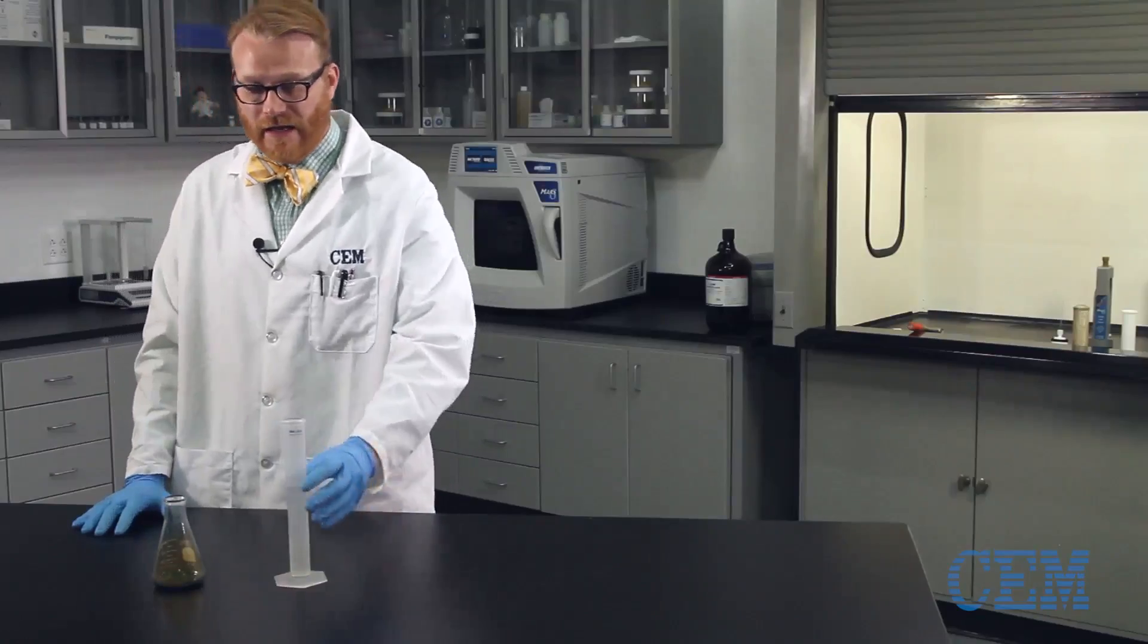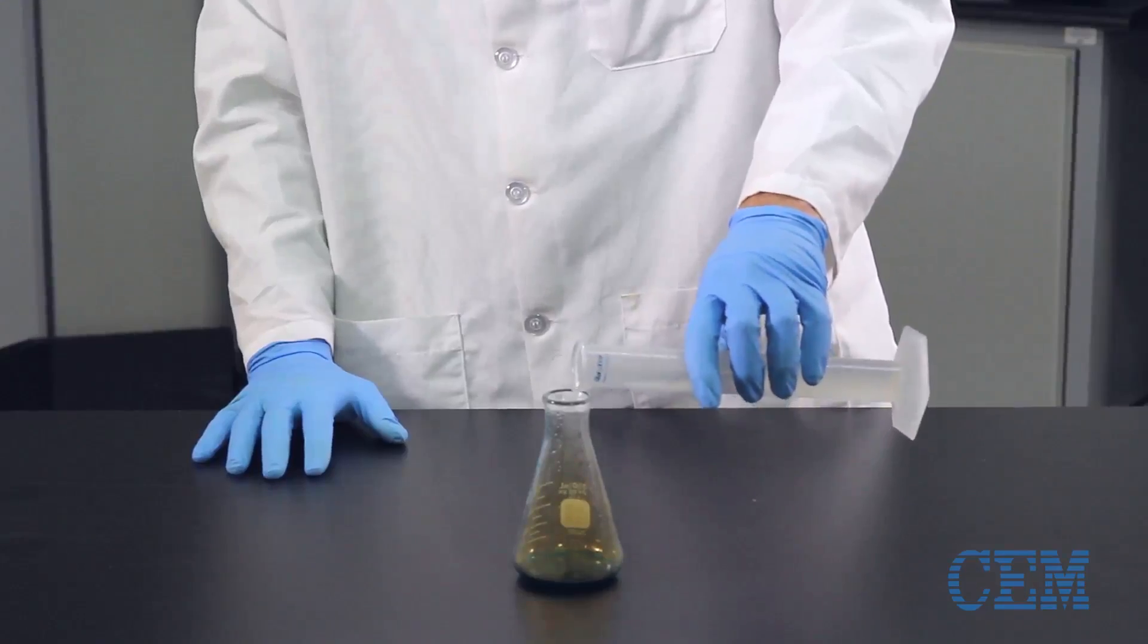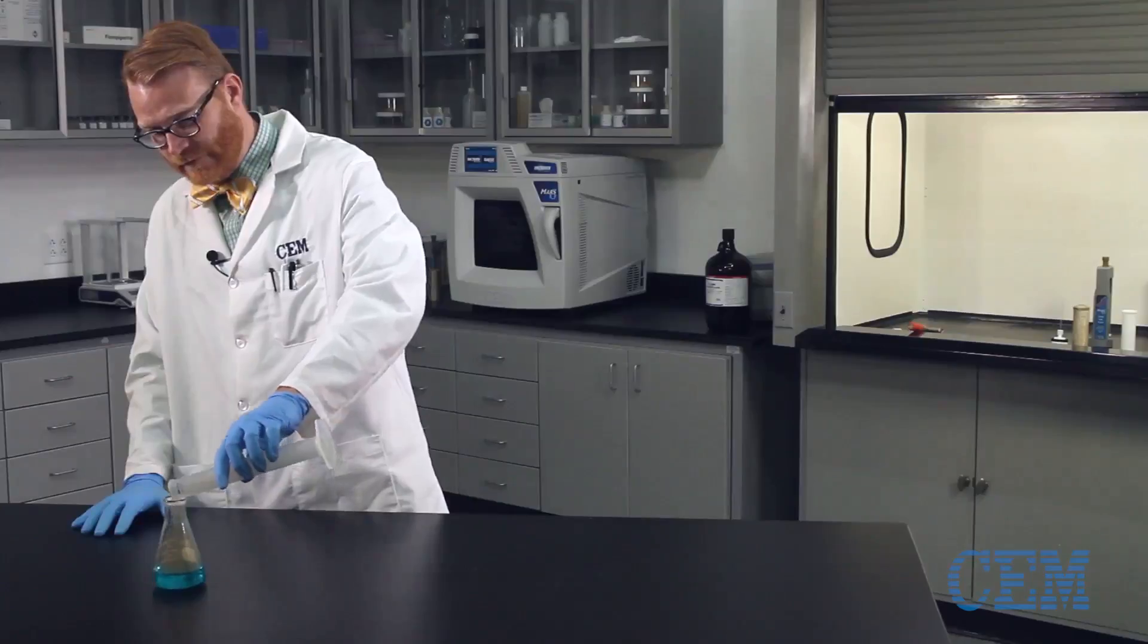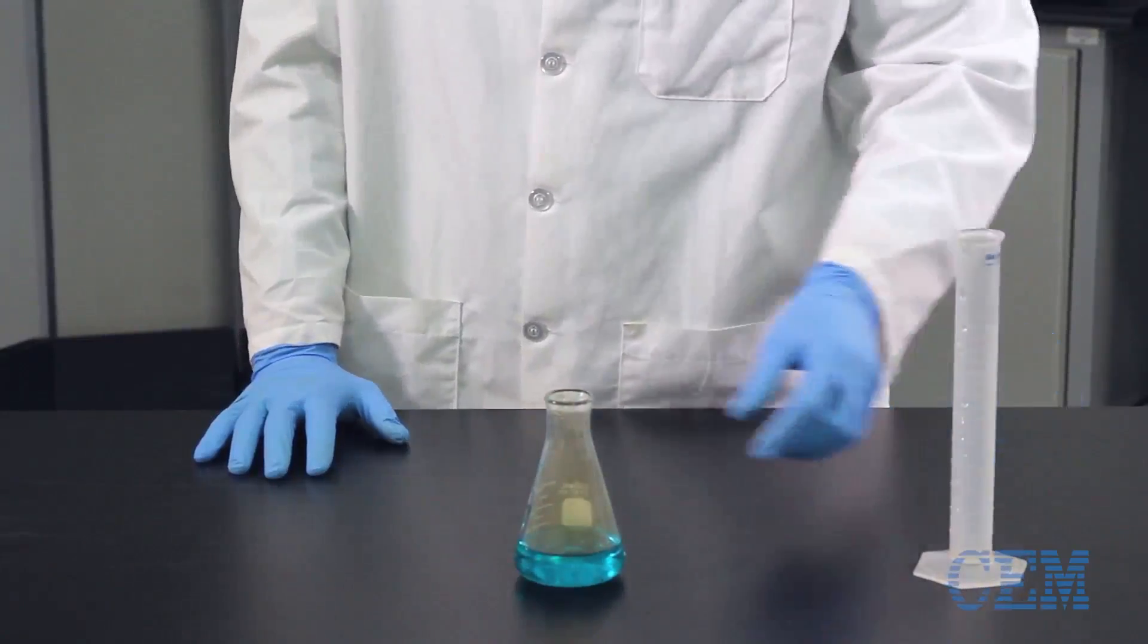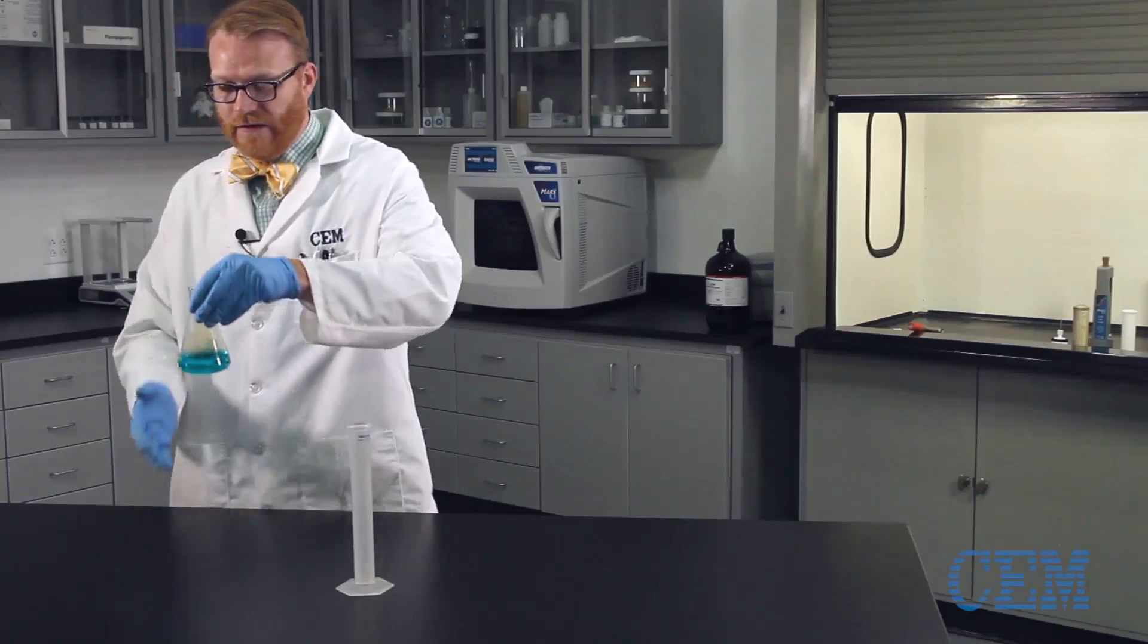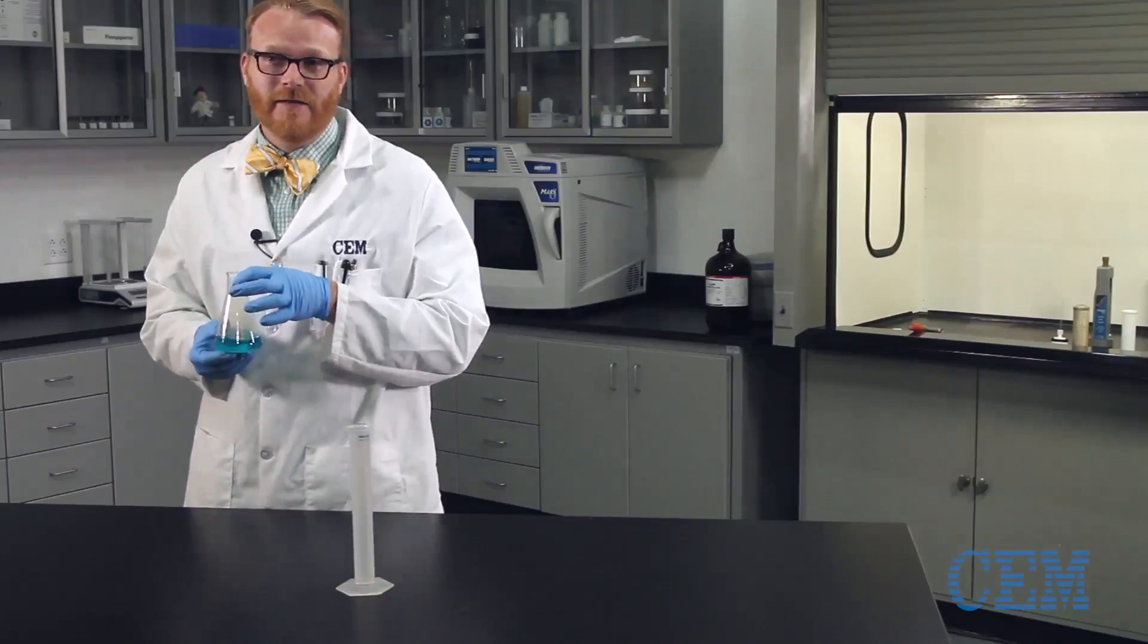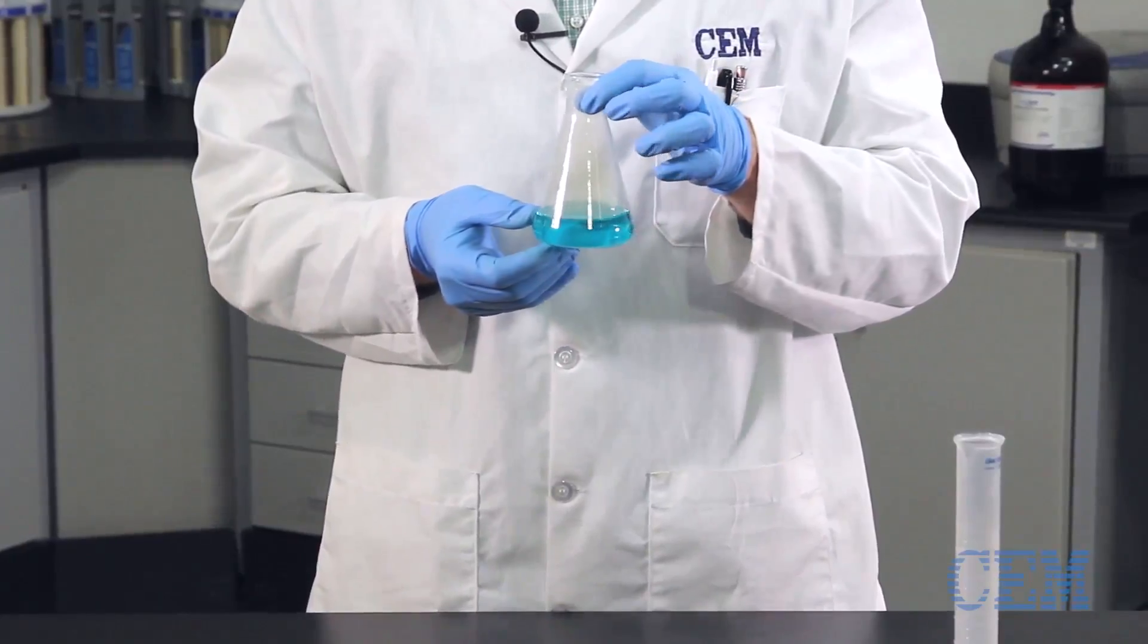So we're going to add some water to this, and take a look. As you can see, there's a blue liquid that's caused by the copper and nickel ions, but we have successfully digested a nickel.